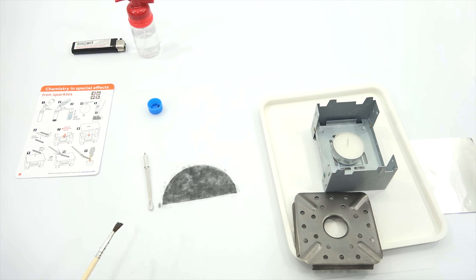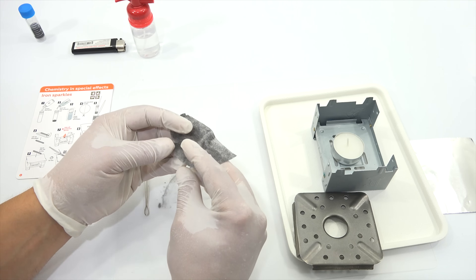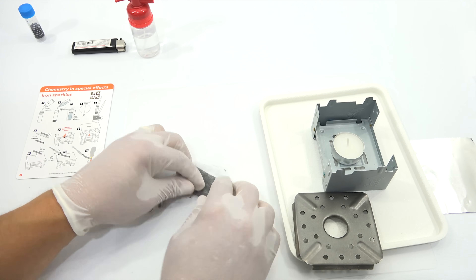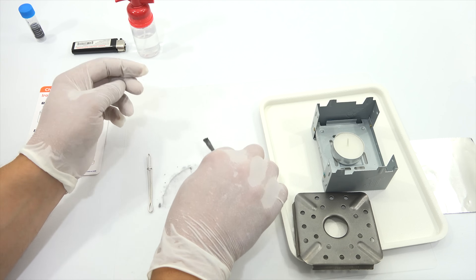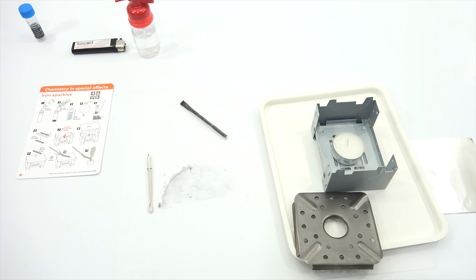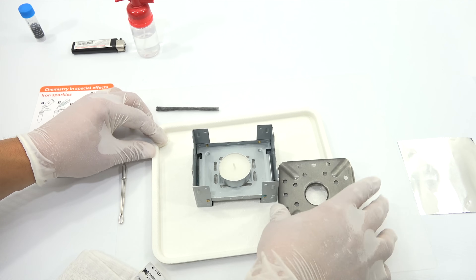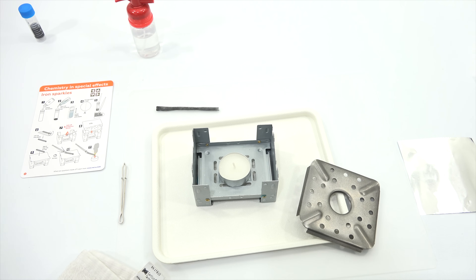Close this up — you don't want to leave these just laying around open. They show it rolling up this way. With gloves on, that's going to not be easy. So that's the length of it — roll up the paper, it says. Take off protective gloves. Light it, and then put the cover and the foil on, and then leave the roll to dry.